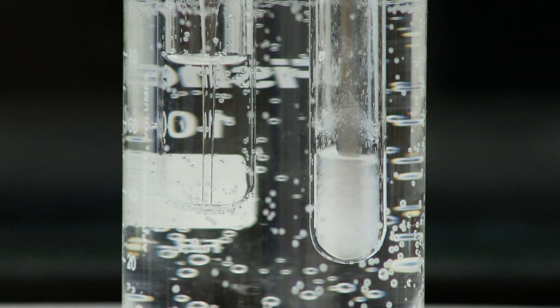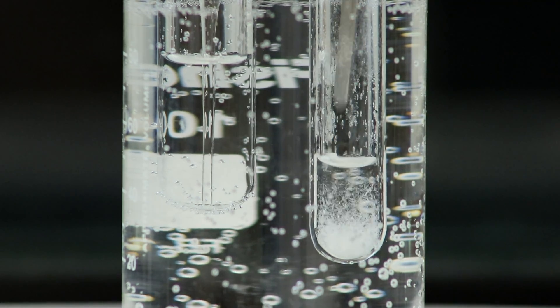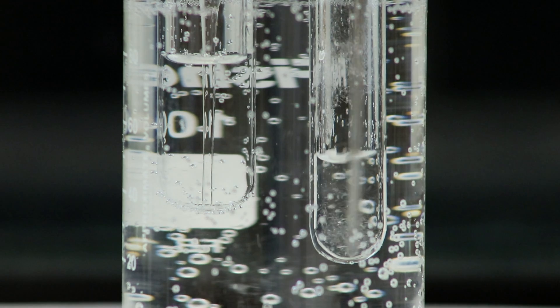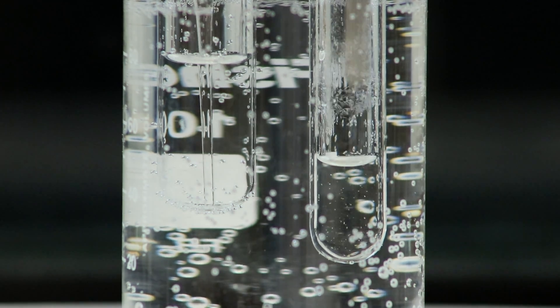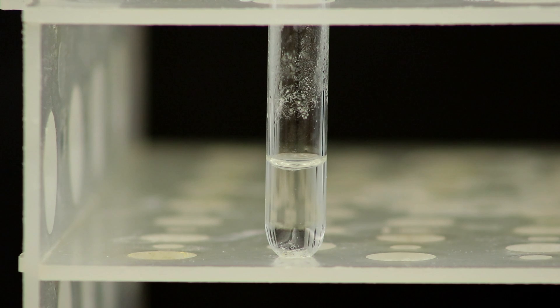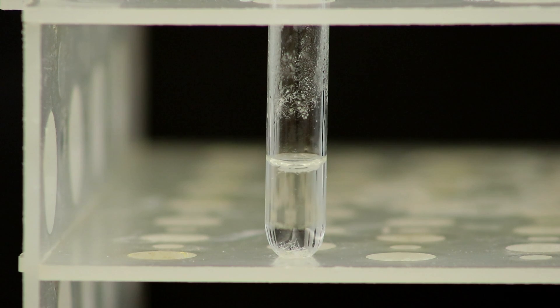Then I'll put it back into the hot water bath to re-dissolve the product and finally leave it on a rack so that the product can recrystallize slowly at room temperature.